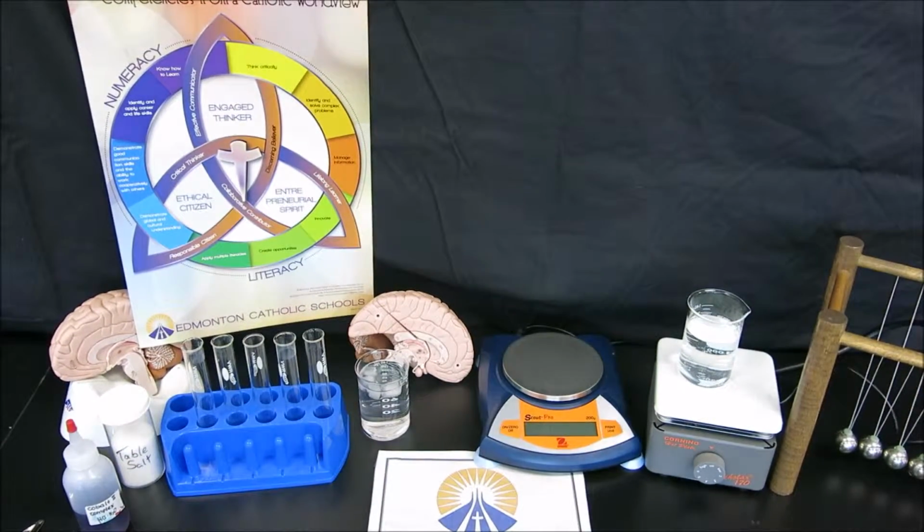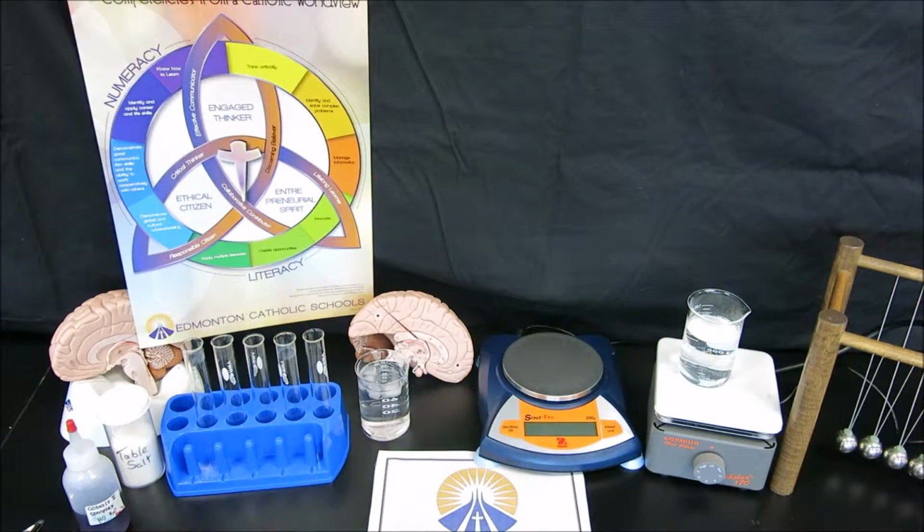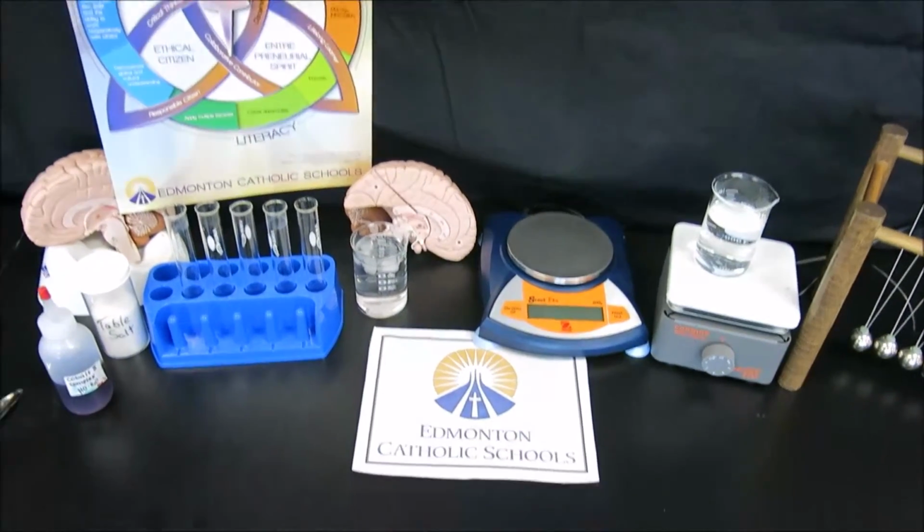In this lab, we're going to be demonstrating equilibrium in terms of Le Chatelier's principle. And Le Chatelier's principle, of course, is the idea that when a system at equilibrium is stressed, that stress will be negated by a shift in the equilibrium, either favoring the products or the reactants. Or another way of saying that is the forward reaction rate becomes more dominant, or the reverse reaction rate becomes more dominant.